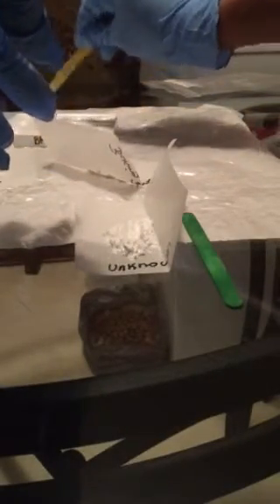Next, it says to use a new wooden scoop and transfer a small amount of baking powder into the 3 wells labeled with the BP. So here we have the baking powder. 1, 2, 3. And put it right there. Next, I think we do each one like that.